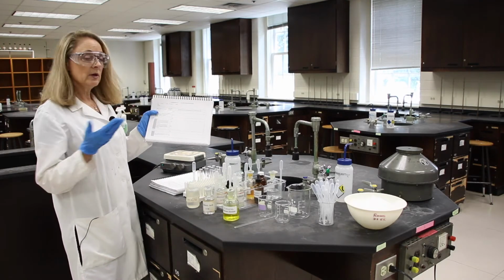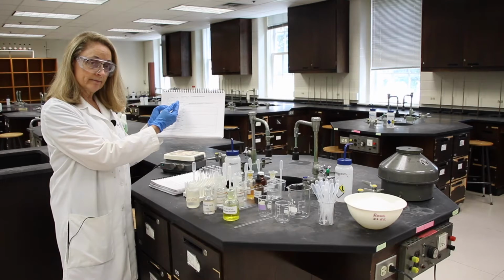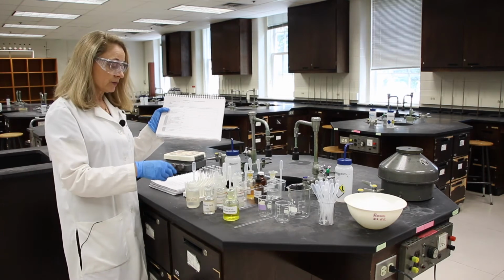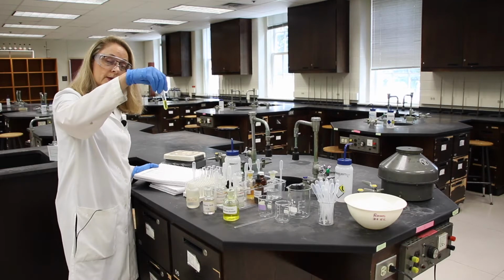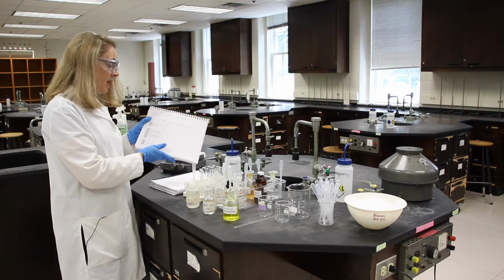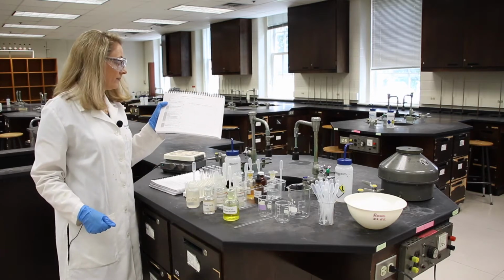So if I have the OH minus ion, what could it react with? How about the H plus ion? And the stress on the system will be adding OH minus. The direction of shift, hopefully you have a left arrow because now you see the color of the reactants. And the observation over in this column is the solution turned yellow.